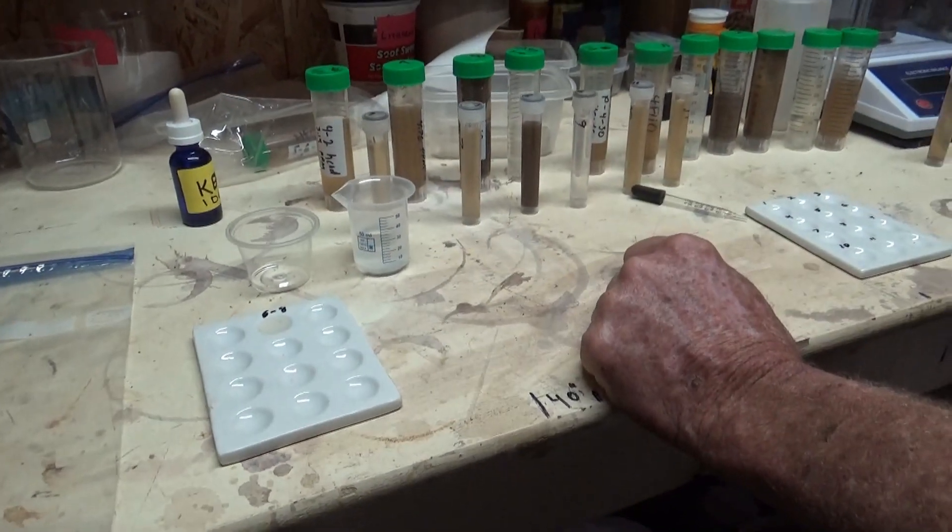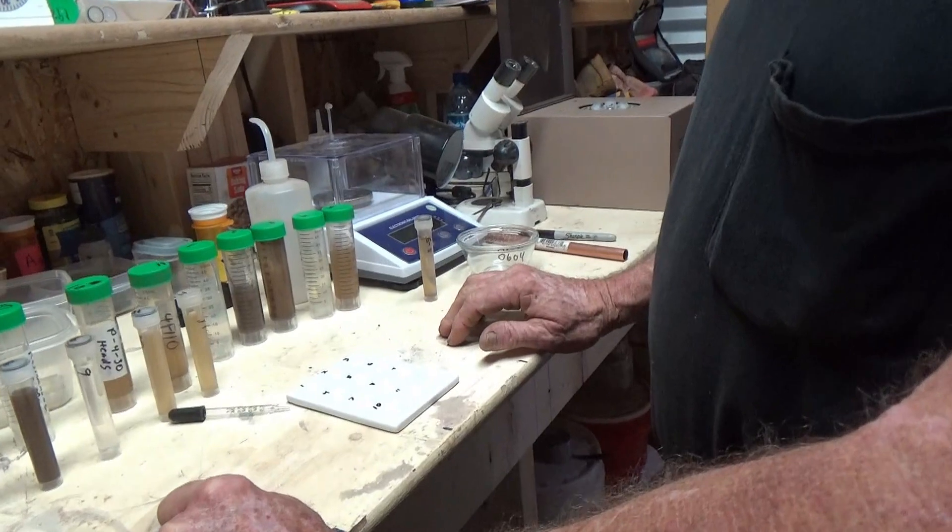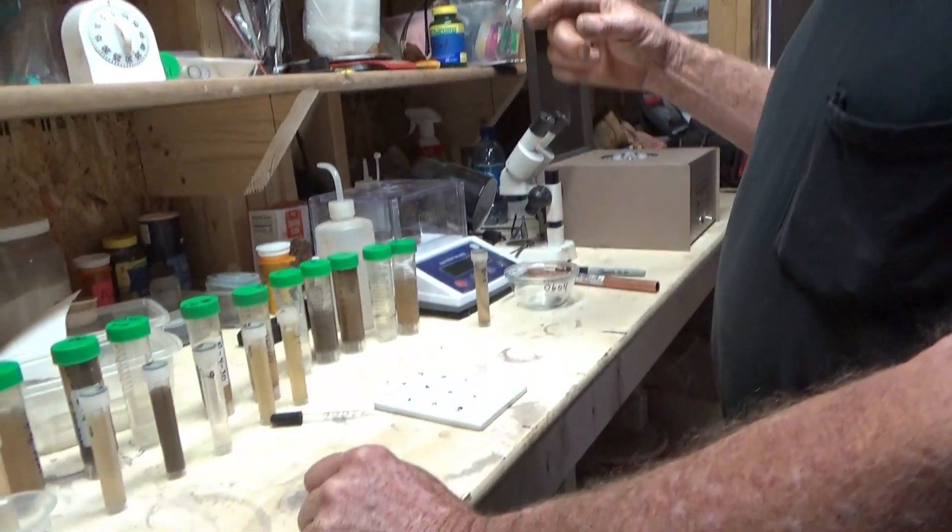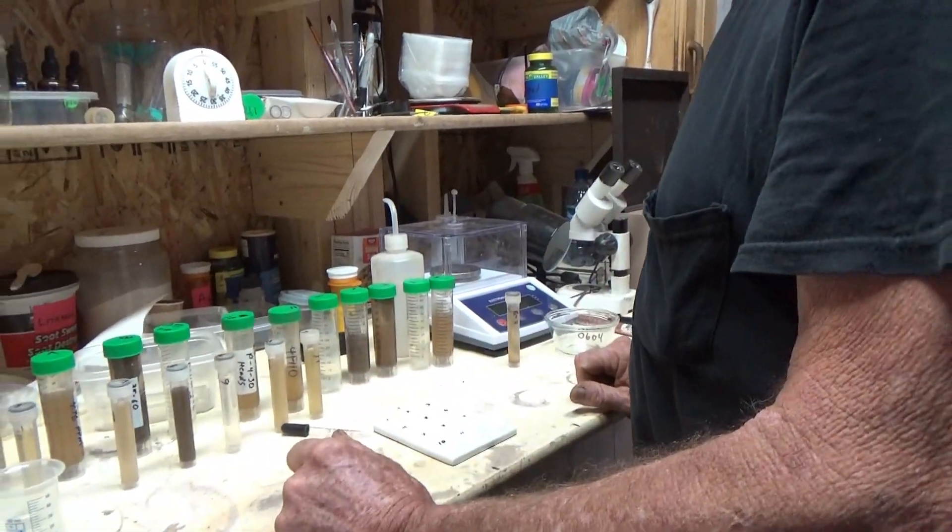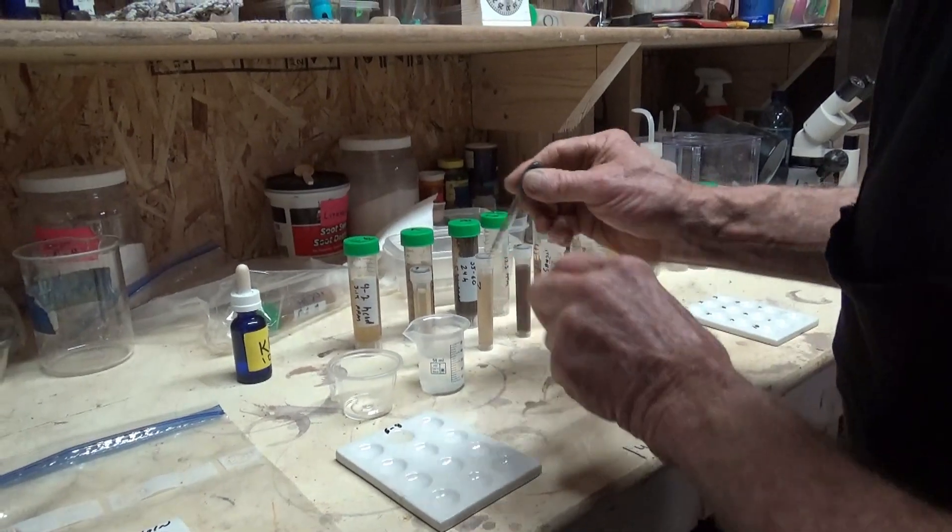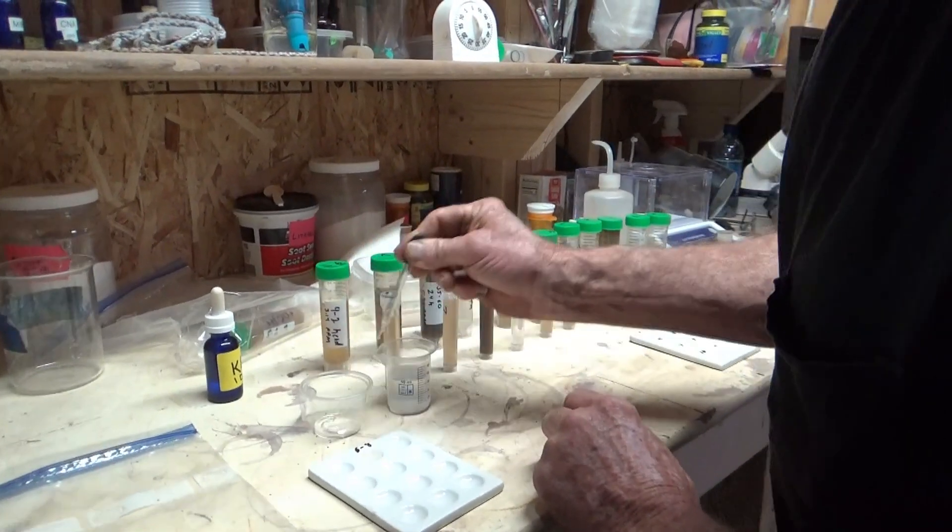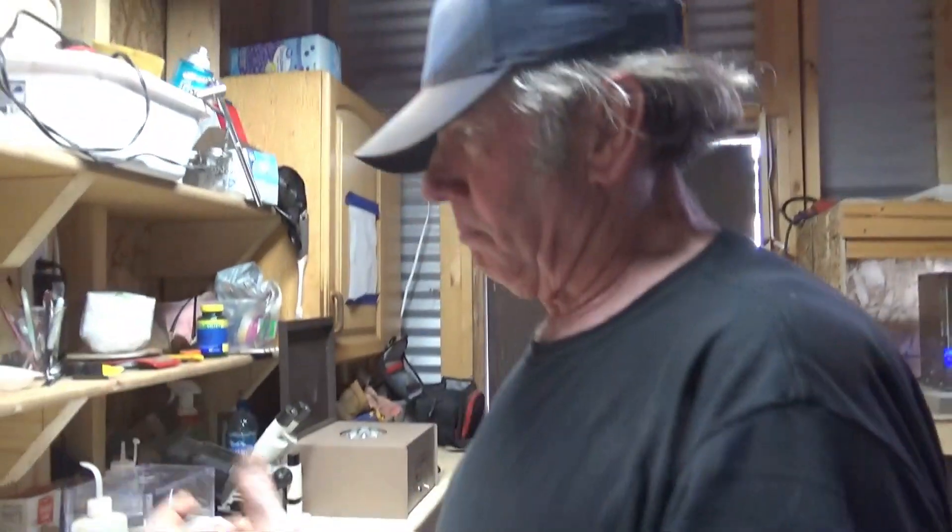Yeah, that's for your laboratory, this is for just reference checking. The reason I only did 11 is because that's an even number so I don't have to do a partially full bottle, you know, one just filled with water to balance the centrifuge.